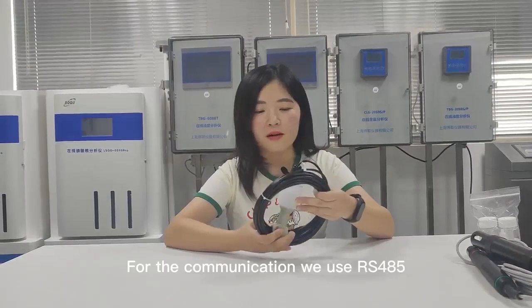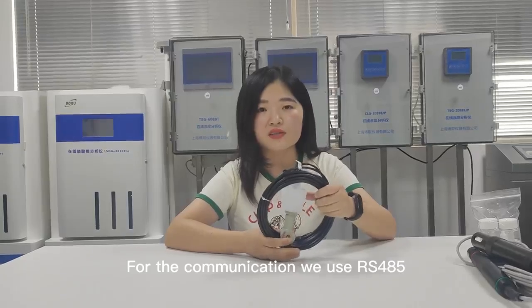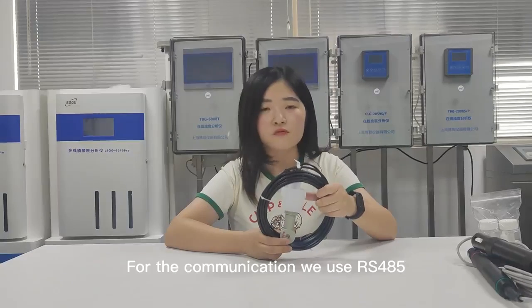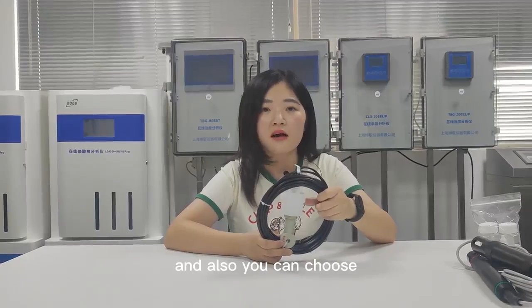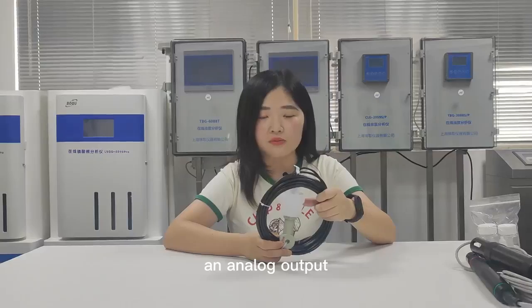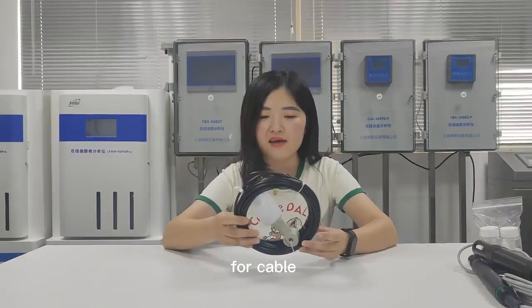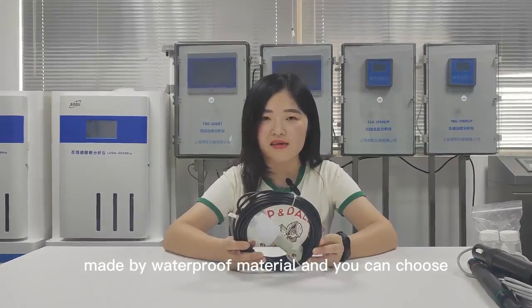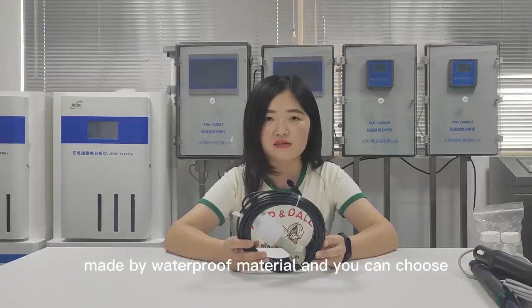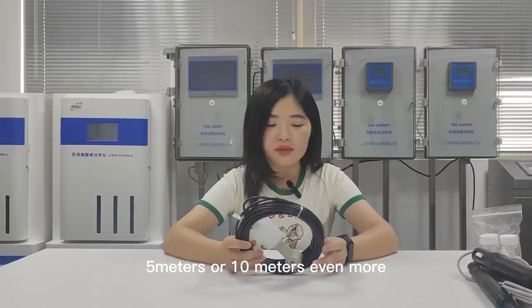For the communication, we used RS-485. And also you can choose analog output, and the cable length is made of waterproof cable. You can choose 5 meters or 10 meters, or even more.